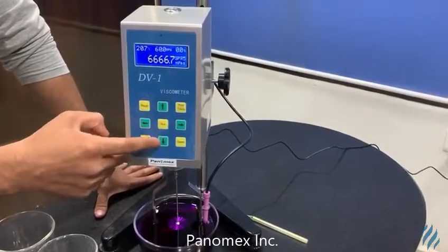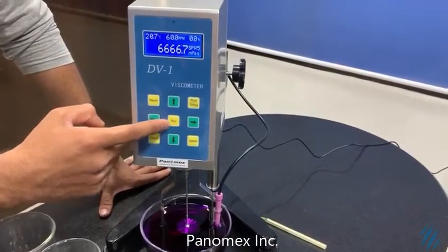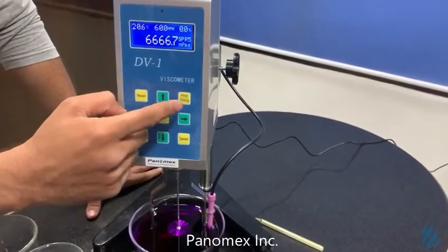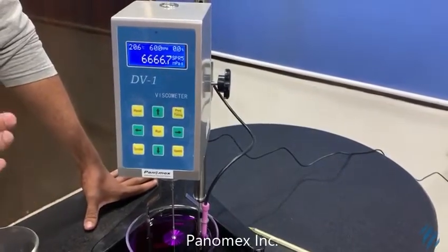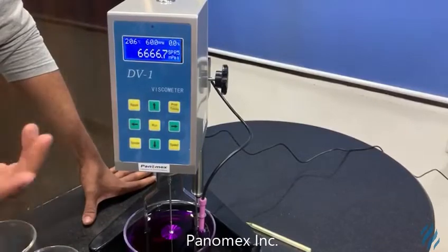These are the up and down keys, and these are the left and right keys. This is the run key for speed, spindle, print, and timing. Now let me show you how this machine actually works.